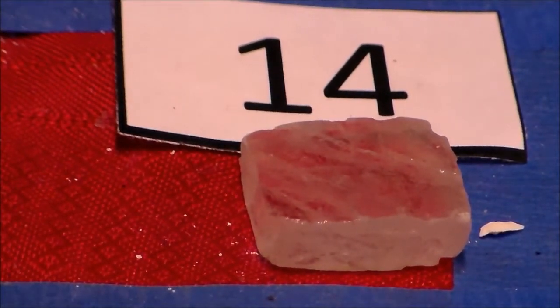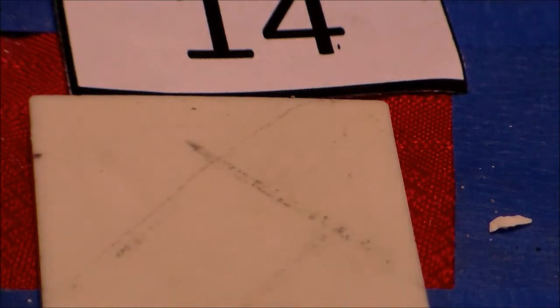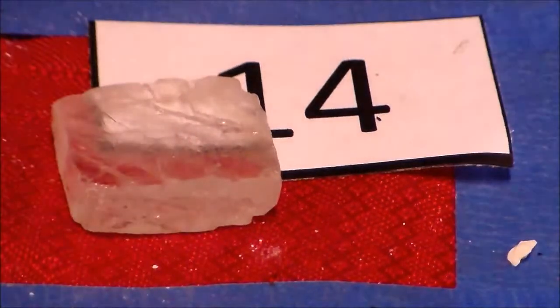It will have a streak that is white, just like the other one. It would be a powdery white streak if I didn't have acid on it. You can see that, it's a powdery white streak. It's cubic, so that should help you put down at least 2 properties, a mineral name and a common use for sample 14.